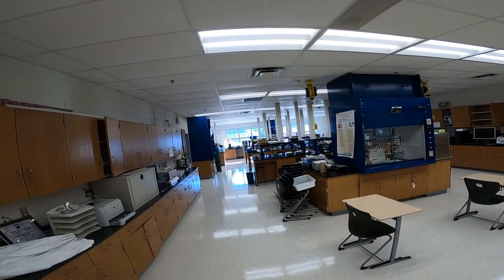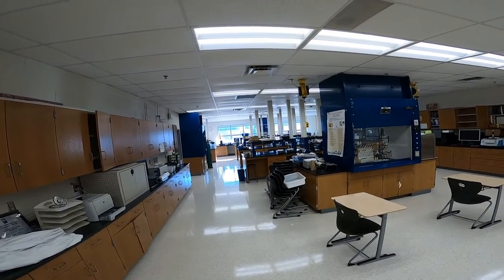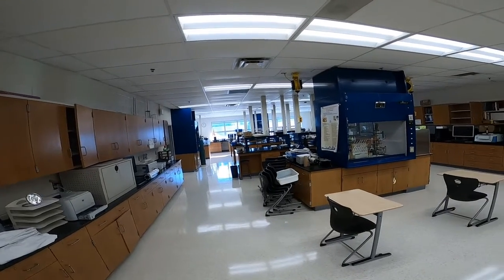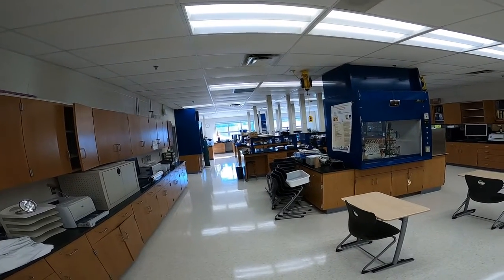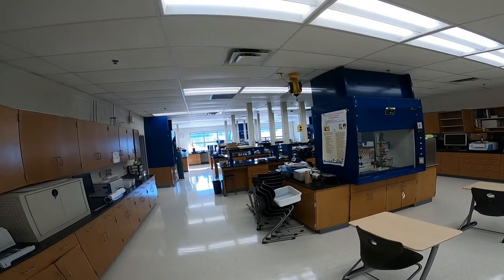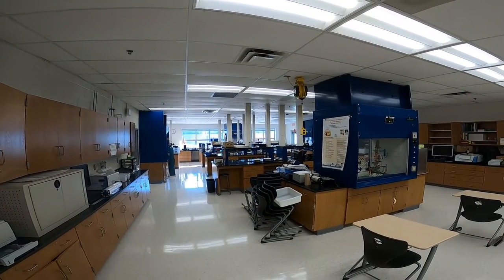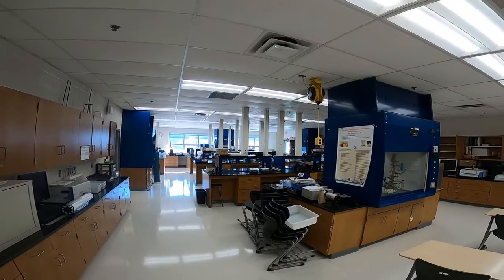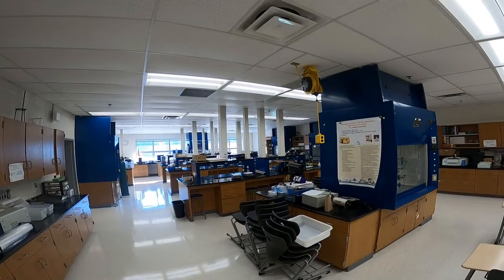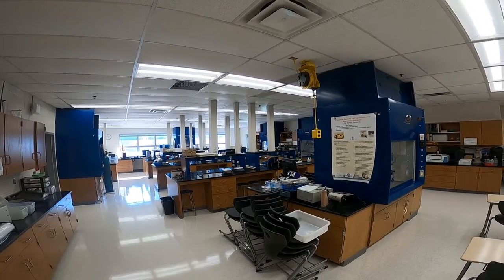Hello students, welcome to the Chemical Analysis and Nanochemistry Research Lab. This is Dr. Kennedy and I'm the lab director for the Chemistry Research Lab. In this lab, the two primary courses taught here are Introduction to Organic Chemistry with Instrumental Analysis and the Chemical Analysis and Nanochemistry Research Lab.